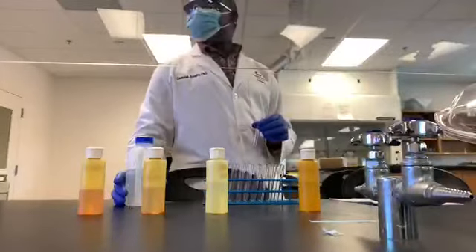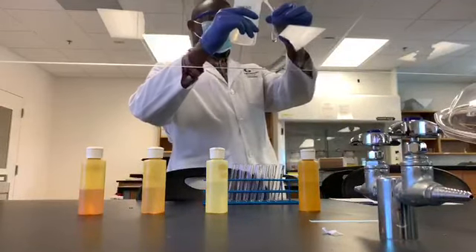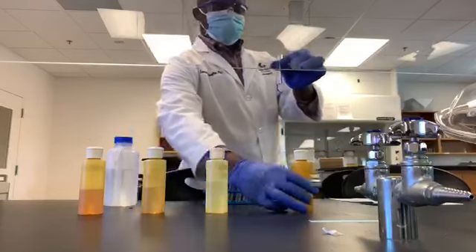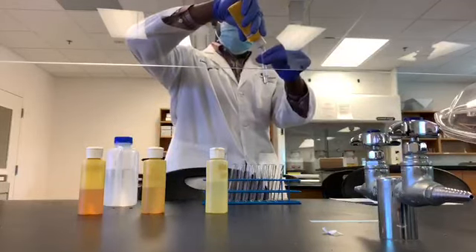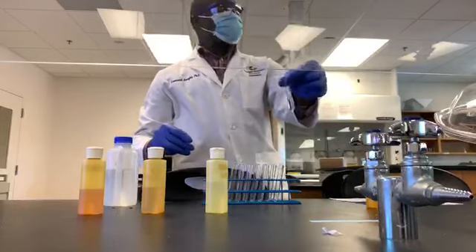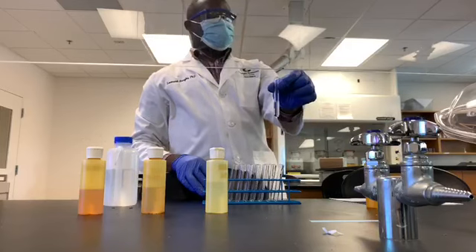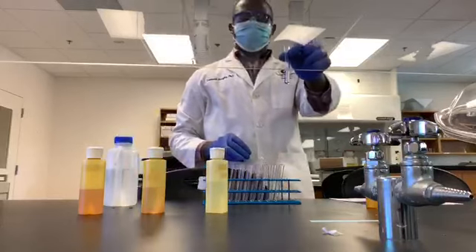Our next mixture will be methanol and water. Let me begin by putting in some amount of water. And I will pour in about the same amount of methanol. So here is methanol. Add in about the same amount. Make sure it's thoroughly mixed. Okay, shake it and allow it to settle, and you make your observations. All right, so with this, please go ahead and state if it is miscible or immiscible.